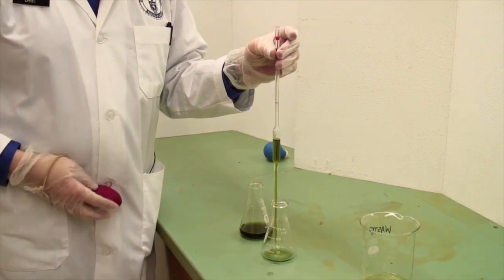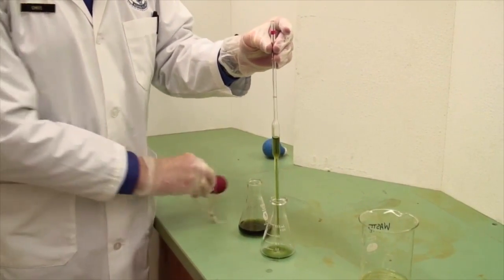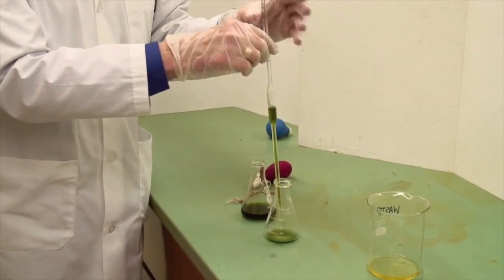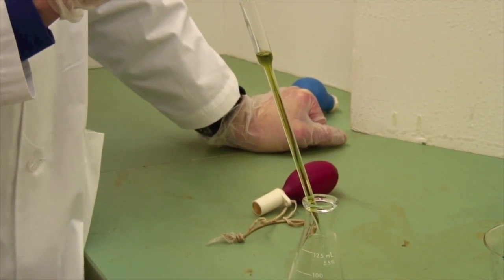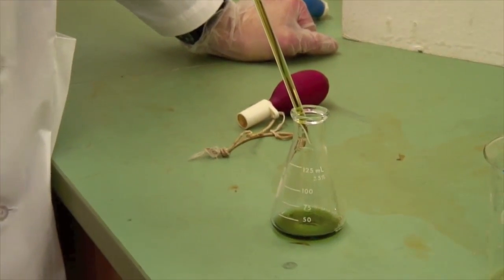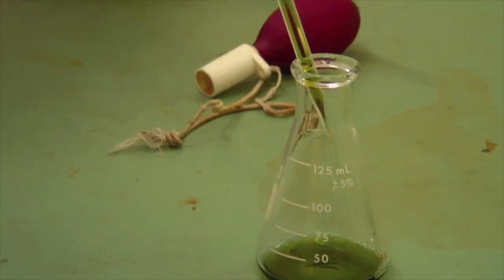Do not squeeze it out at this point. You need to be patient and let gravity do its thing. This is now dispensing 10.00 milliliters, or an aliquot of 10 milliliters.